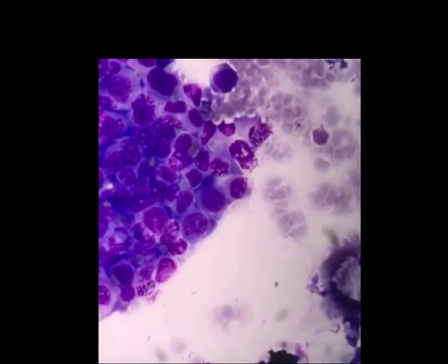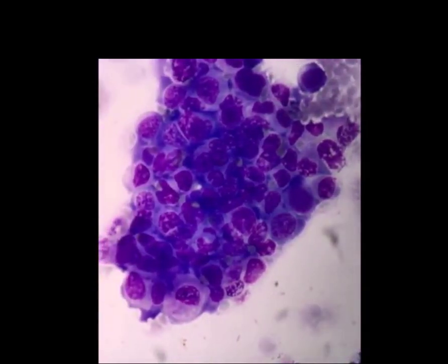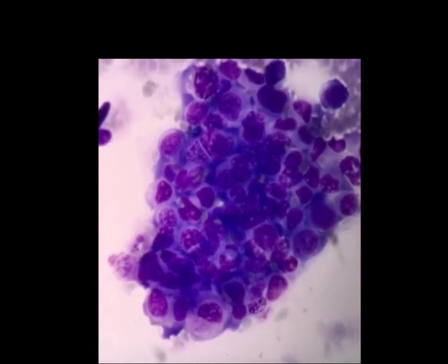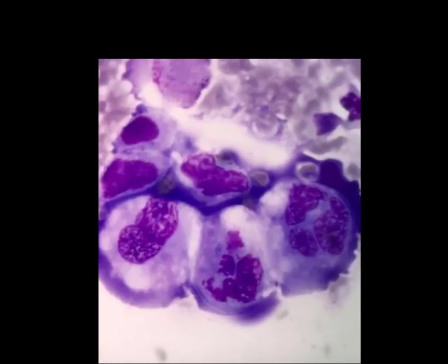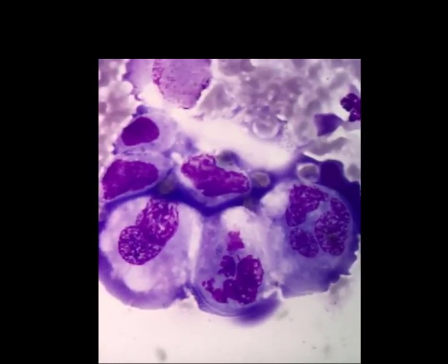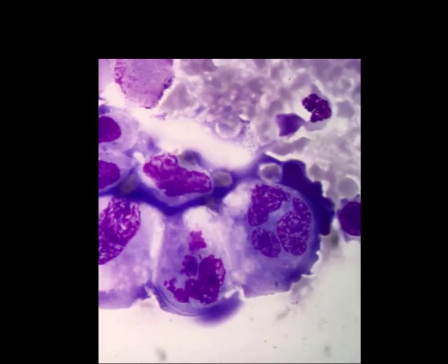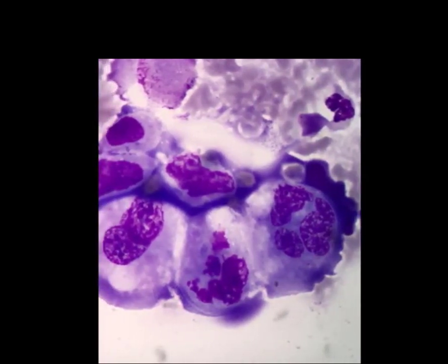We start to see more cell detail, anisocytosis, difference in cell size, anisokaryosis, difference in the size of the nuclei. The cytoplasm is hyperbasophilic, and sometimes the nucleolus is prominent. What you can see here is another area of multinucleation. To the right, the presence of anisokaryosis within a cell, which has an odd number of nuclei, and in the centre, a cell in unsynchronized mitosis.